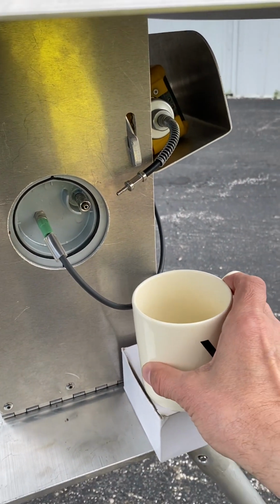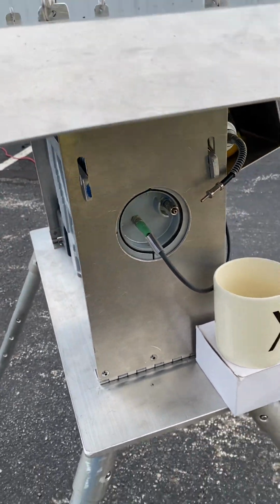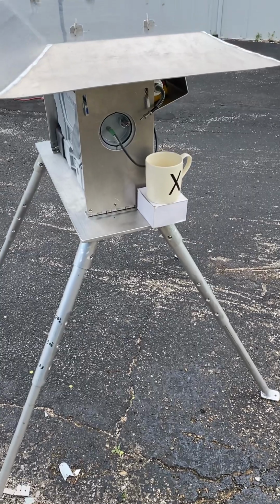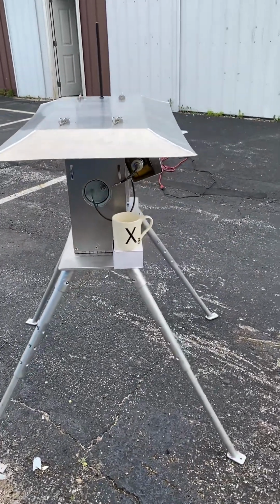It's a little cold out too, so it's not really going to be super volatile, but it is going to maybe get up and go. So we're hopeful when we go back and take a look at the GUI, the CRID software, we are going to get some hits. But anyway, that's the system. Very, very kind of neat and kind of cool.